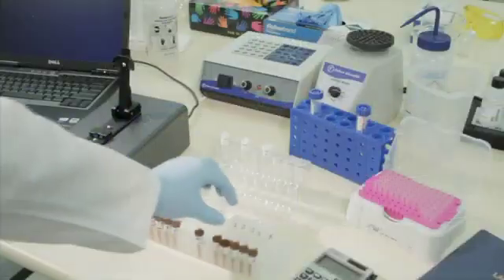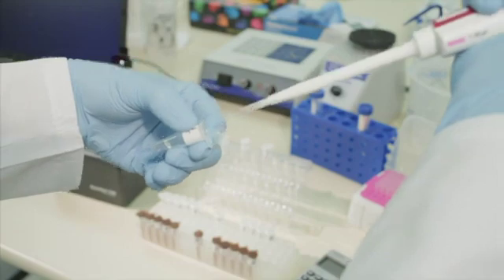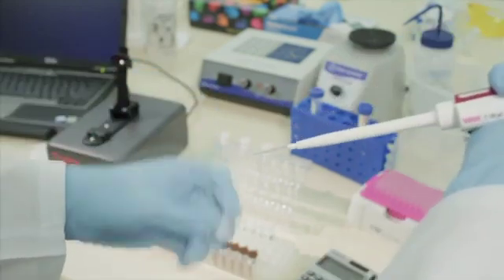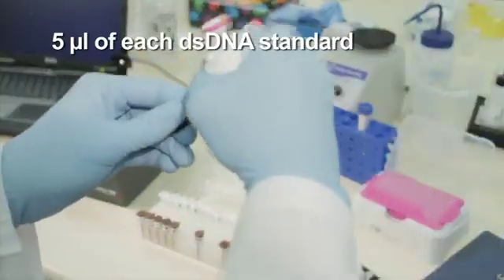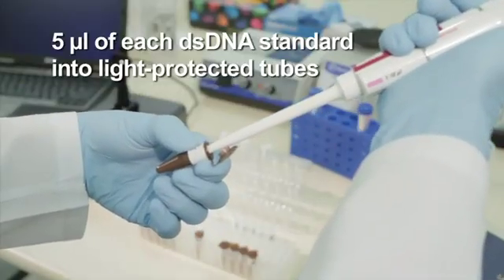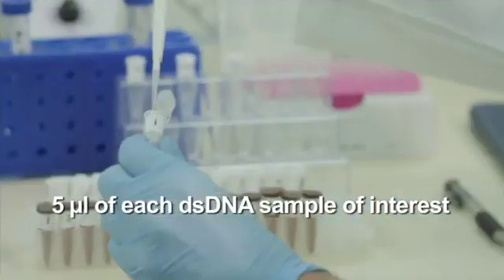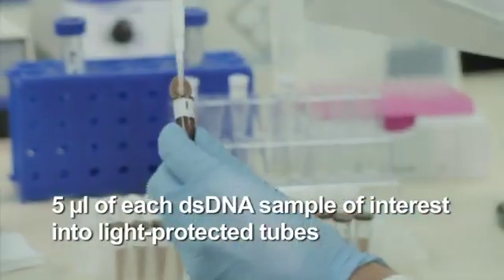Next, prepare serially diluted double-stranded DNA standards in nuclease-free vials or tubes that will cover the expected concentration range of the unknown DNA samples. Transfer 5 microliters of each of the diluted double-stranded DNA standards into an individually labeled nuclease-free amber or foil-covered tube. Then, aliquot 5 microliters of each double-stranded DNA sample of interest into the appropriately light-protected tube.